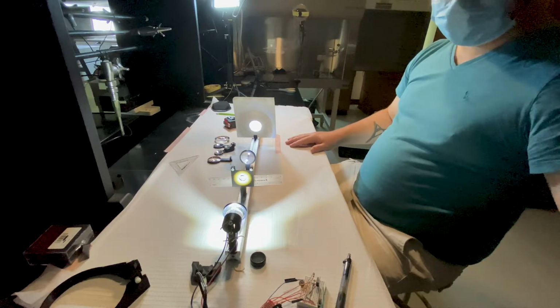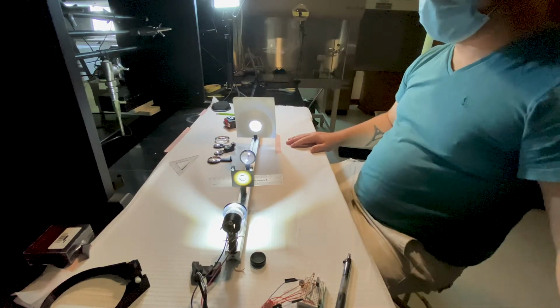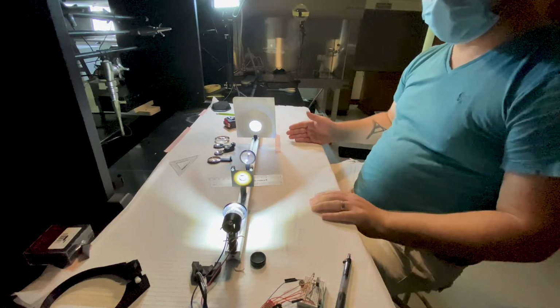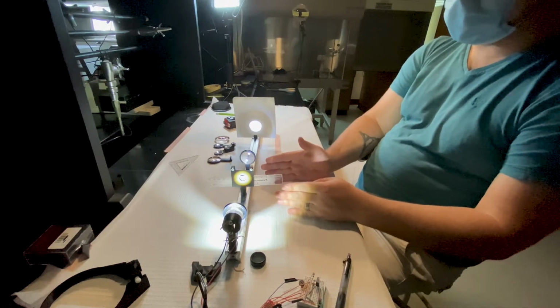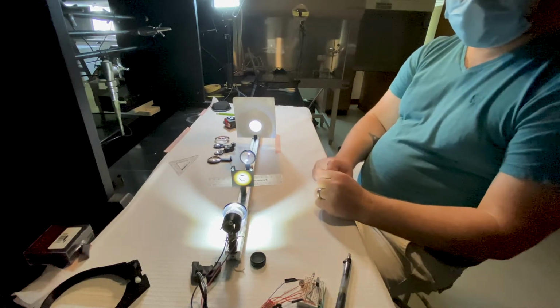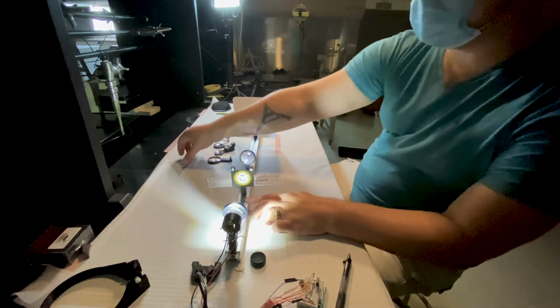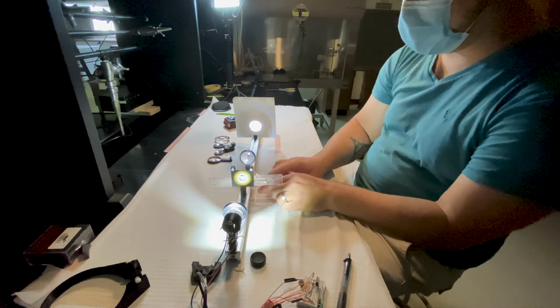So now, after you've done that, we were going to be changing the way that we mount our sample. Before, we had it mounted more than 70 millimeters away from our lens. Now let's see what happens if instead of 70 millimeters, let's just call it 50.